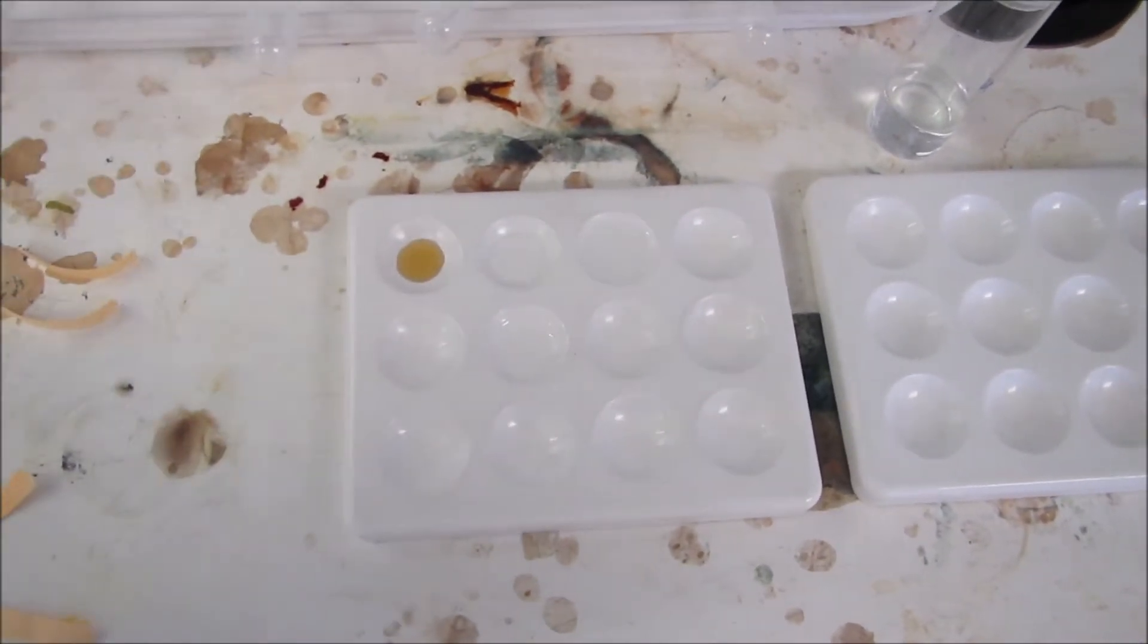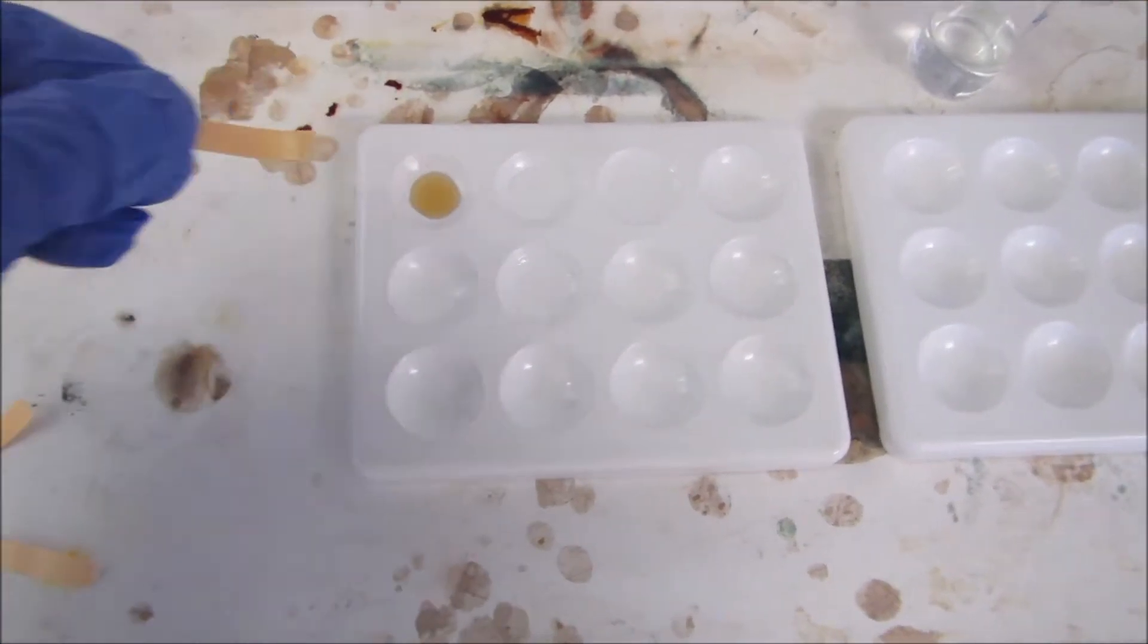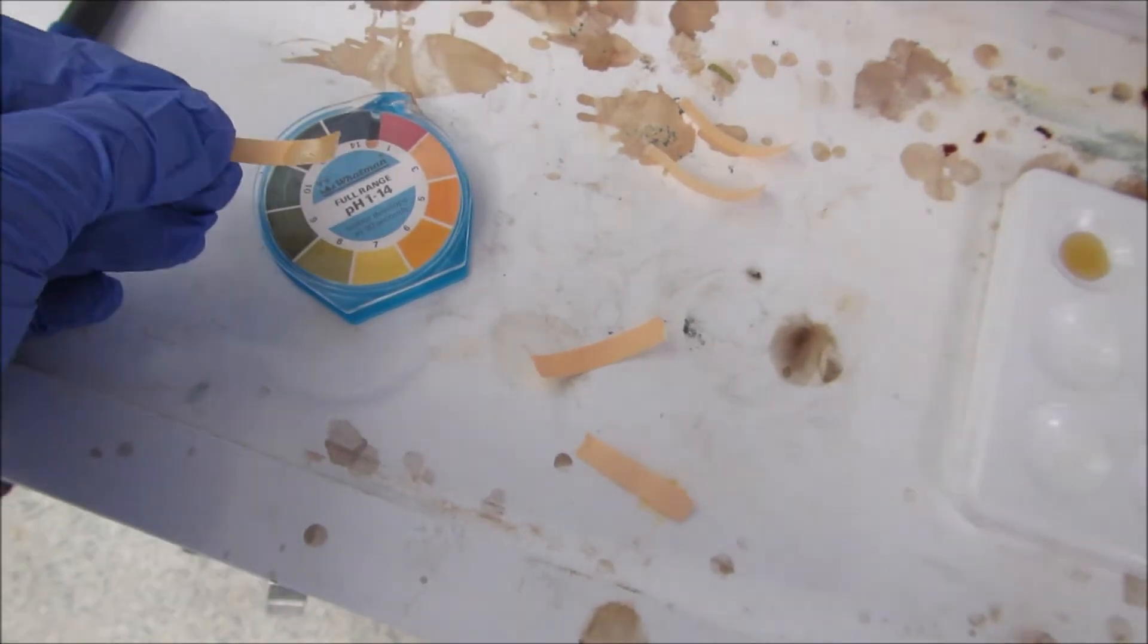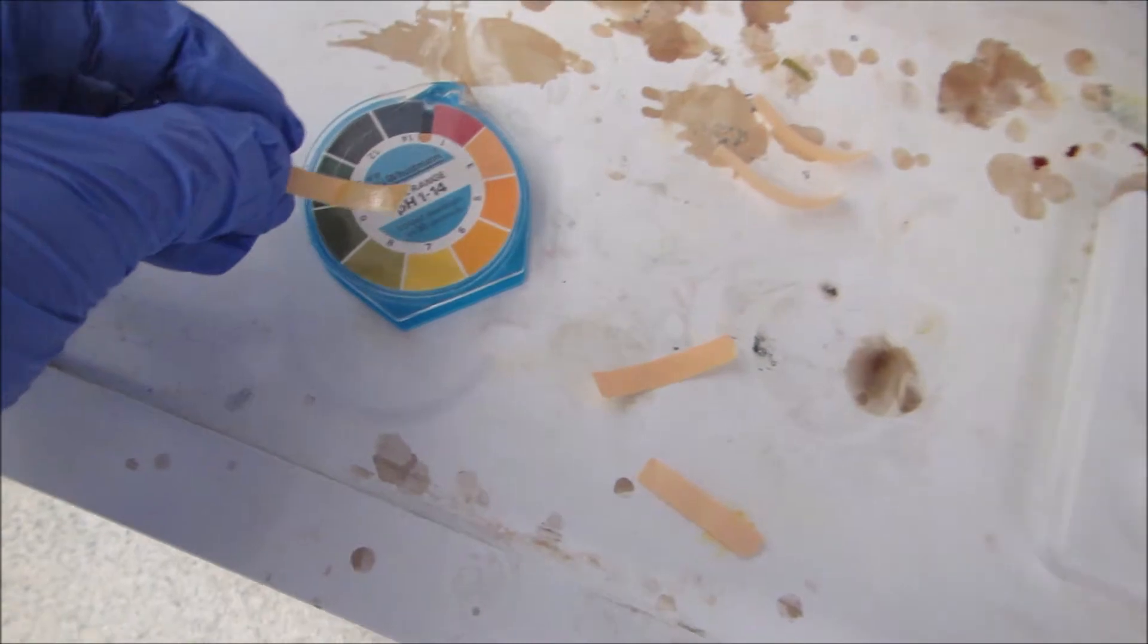I'm just going to measure pH. Firstly, I'm measuring pH. So number one, if I hold it against the pH chart, try and work out which one you think it is.